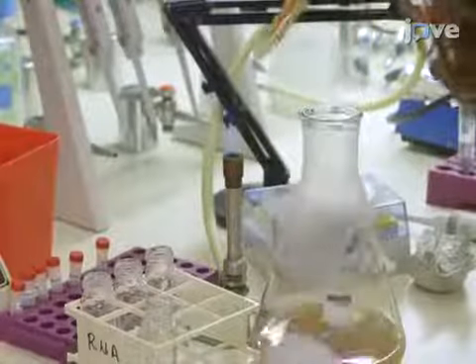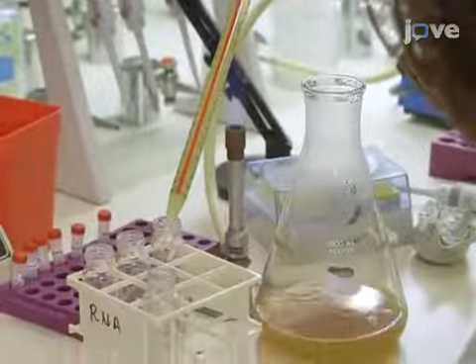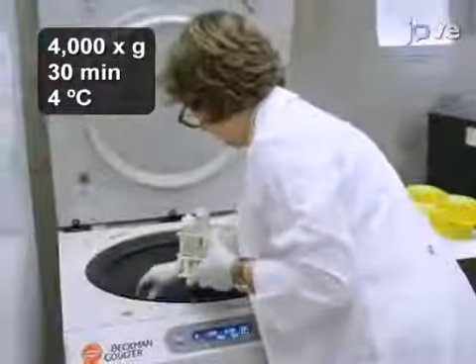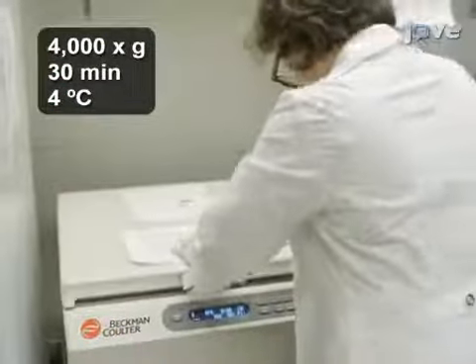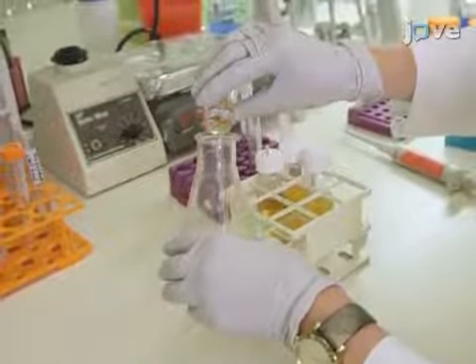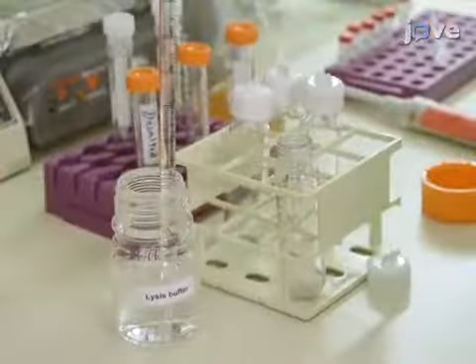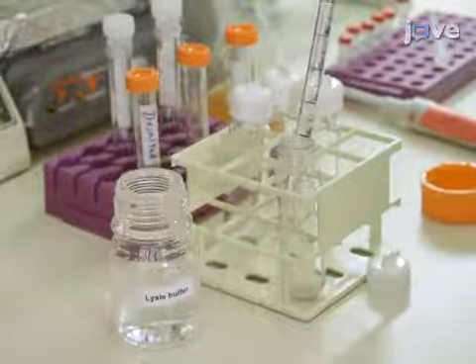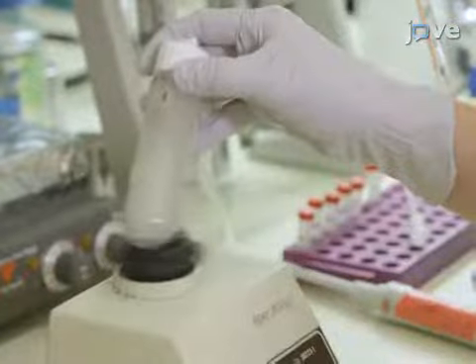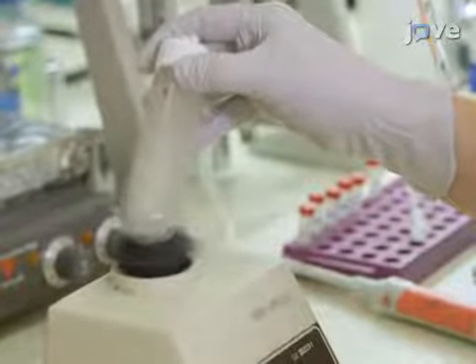After 3 hours, lyse the bacteria to solubilize the inclusion bodies by first pelleting the induced BL21 culture and discarding the supernatant. Then, resuspend the pellet in 10 milliliters of lysis buffer and allow the cells to be lysed for 15 minutes.